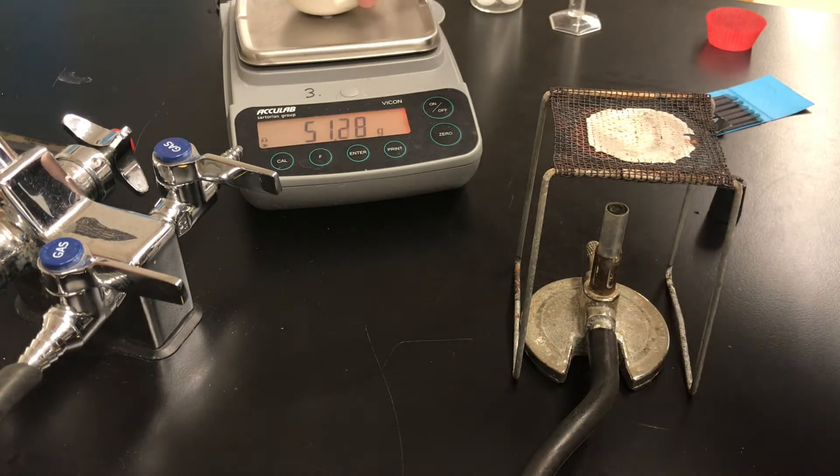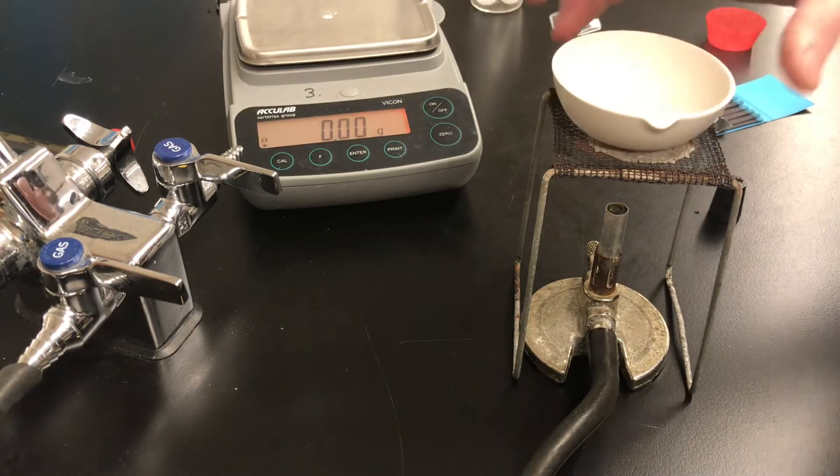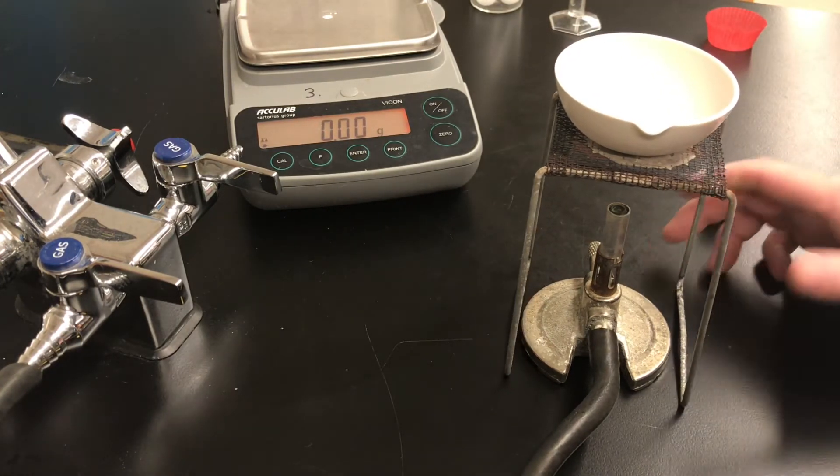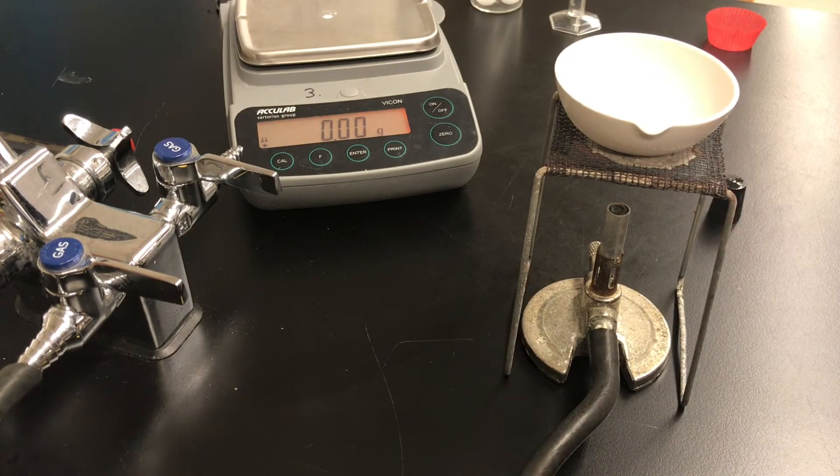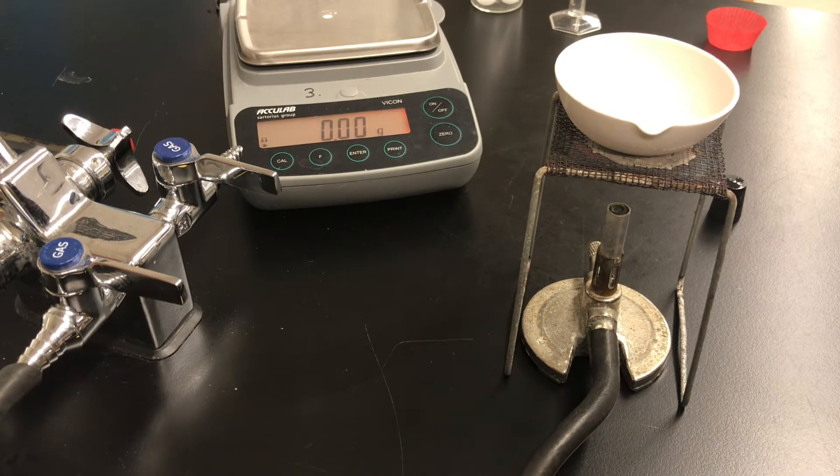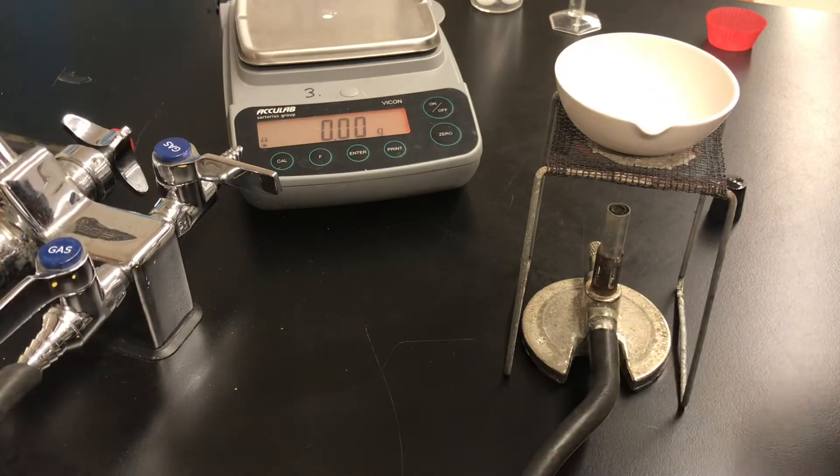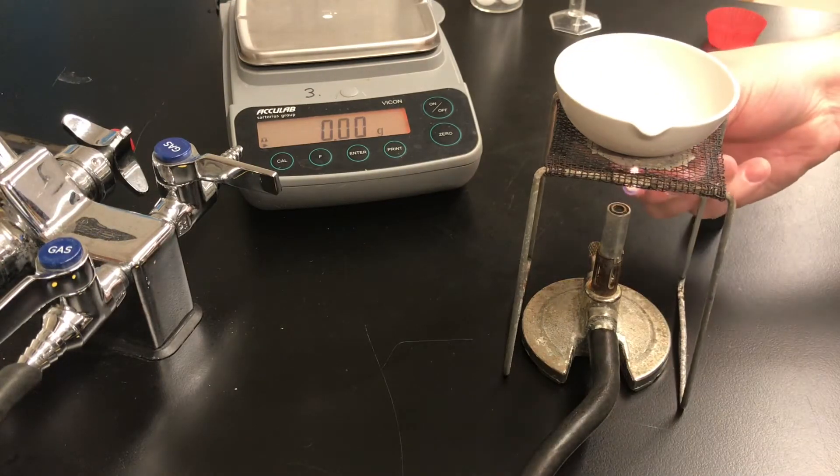Now let's use the evaporating dish as its name suggests. We're going to evaporate the water from the solution. I've got a wire stand and a small micro burner. I'll turn the gas on. I'm going to light the burner.